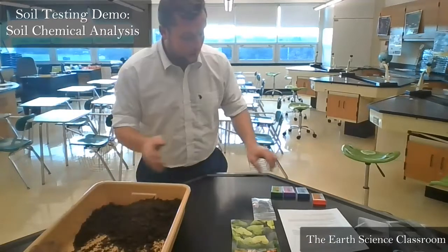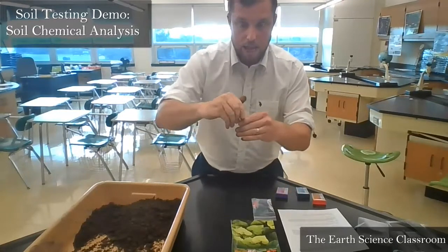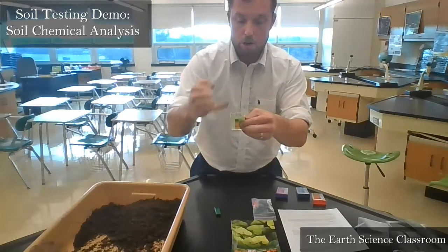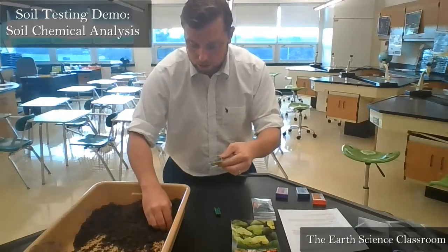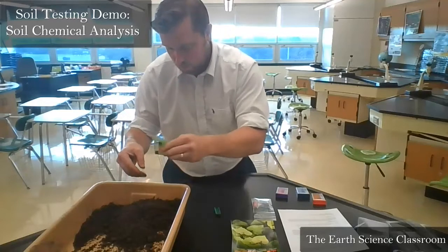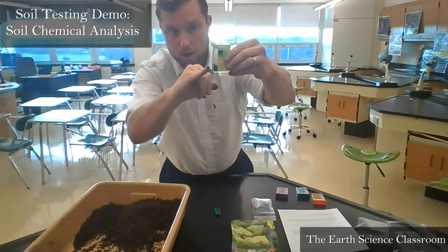We have our little tubes right here, our little equipment, and it's very simple. You take the cap off, like so, and you have a small area and a large area. You always put the soil into the small area. You get a little pinch of soil with your fingertips and put it in. It's a bit too much. A little bit of soil in the bottom, like so, just right there.